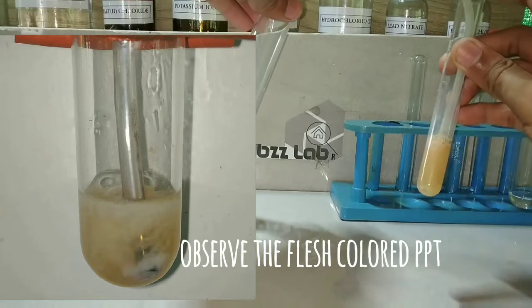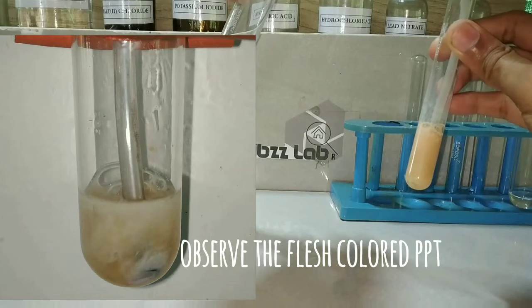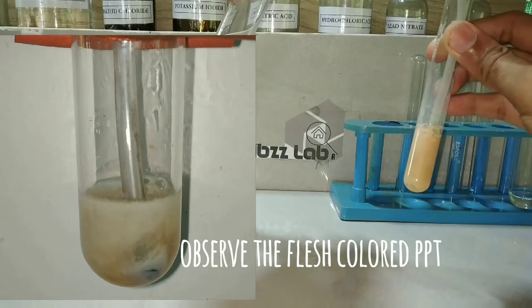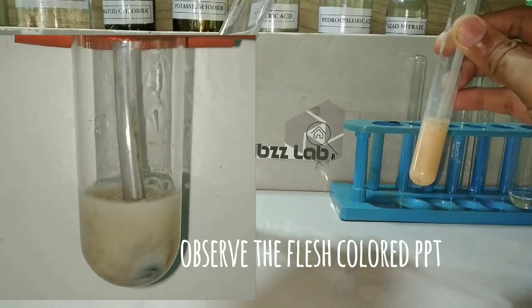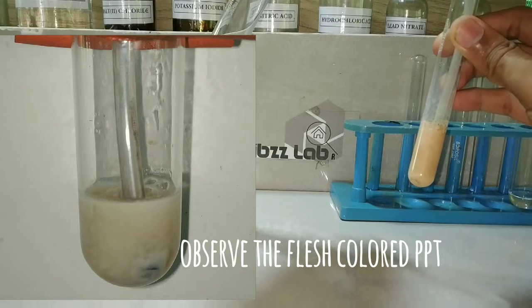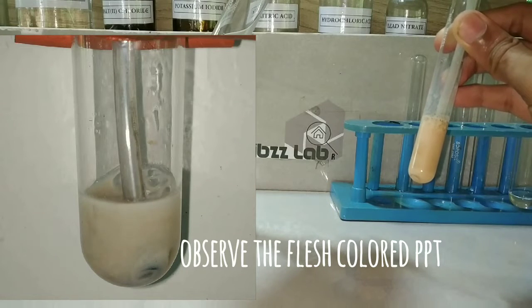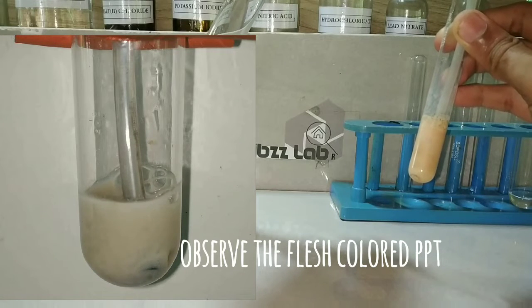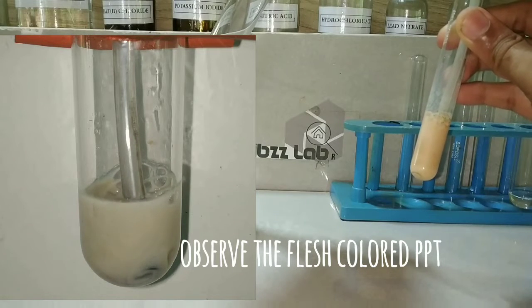On passing hydrogen sulfide, there is formation of a flesh-colored precipitate. The flesh-colored means it is dull white or a light brown color.